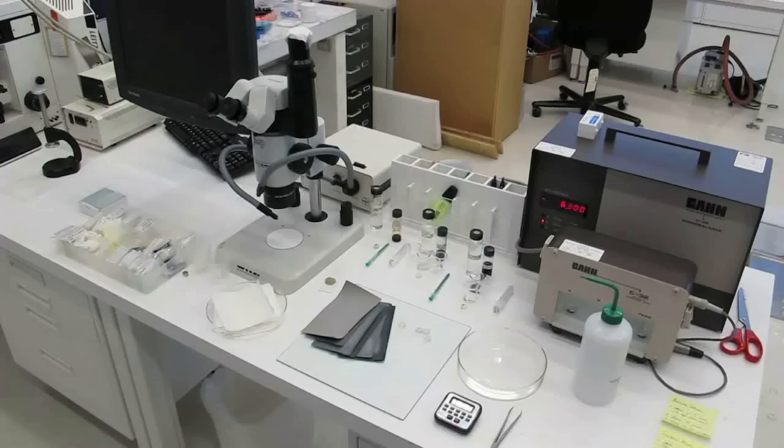For the histochemical staining of cross-section samples, the workspace should be set up with micro-mesh for polishing the samples, various staining solutions and rinsing solutions and dishes, some tweezers, some small pieces of tissue paper and a timer.